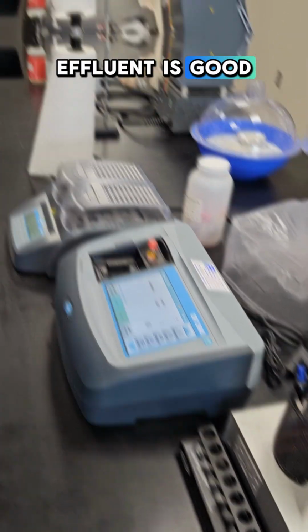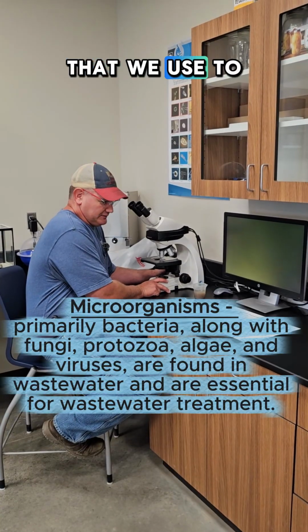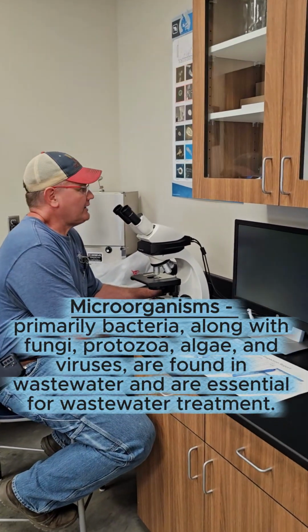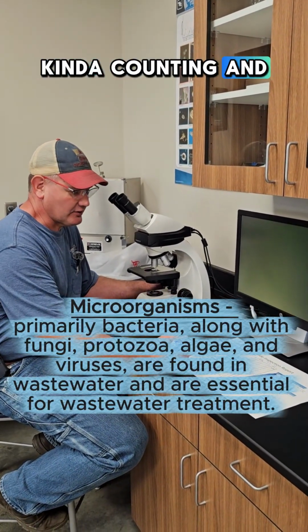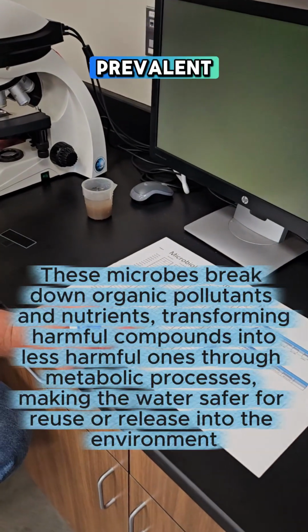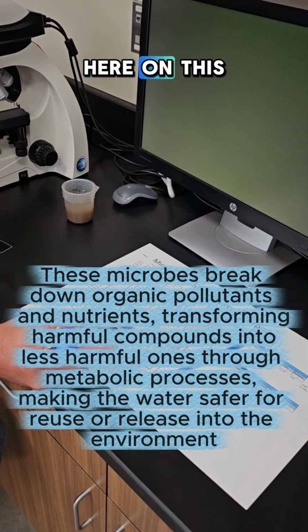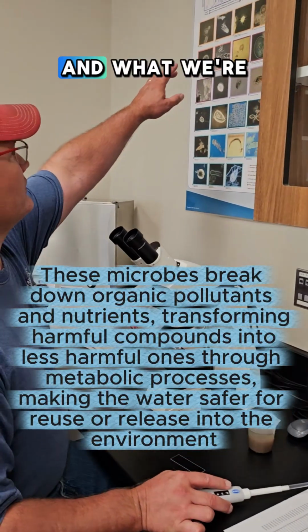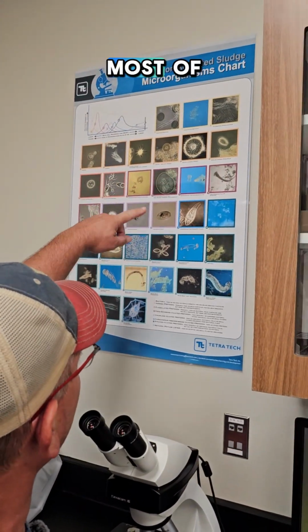So this is one of the things we do on a regular basis to make sure our effluent is good. Okay, this is our microscope that we use to look at our microorganisms on a regular basis. What we're doing is counting and quantifying which organisms are more prevalent, and then we record their frequency here on this log about every other day.